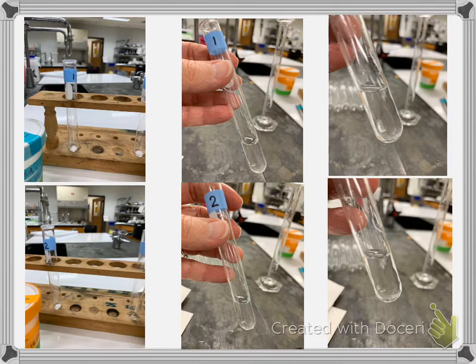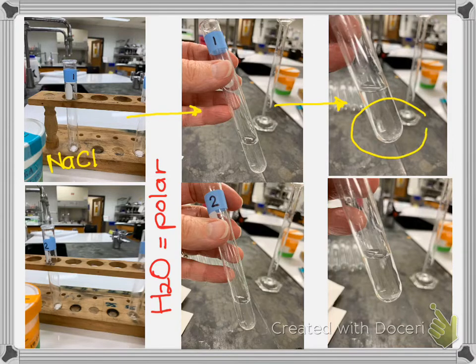Okay, so my first example, this is with water. Let me see if I can write on the side here, water. And water is polar. So first I have NaCl. And here it is close. And so looking in, this is a uniform solution. There's nothing left. And so we would write soluble, or your book says you can just write S.